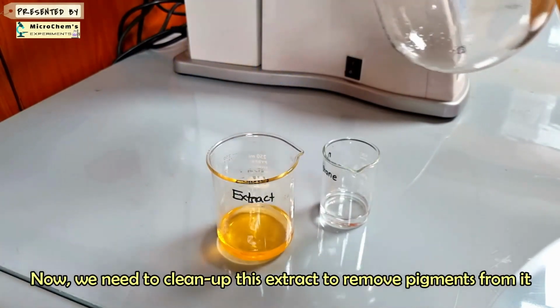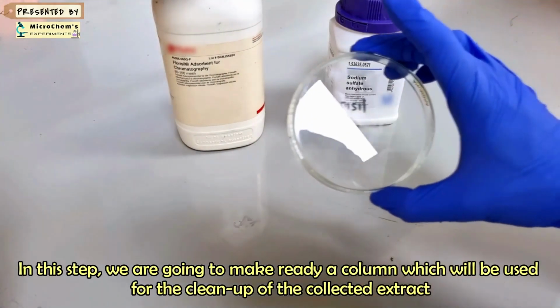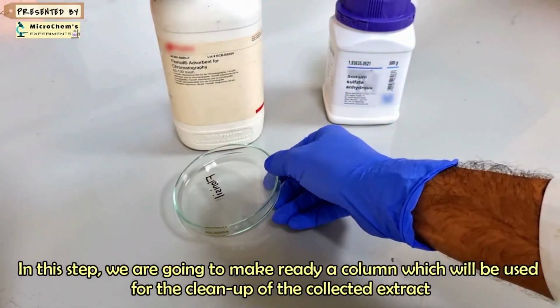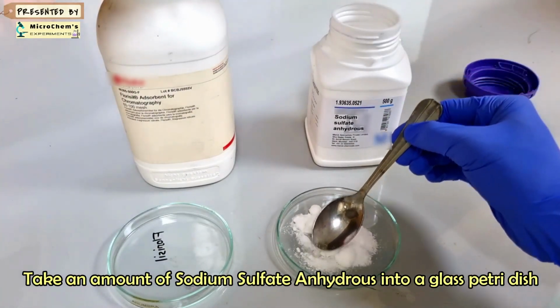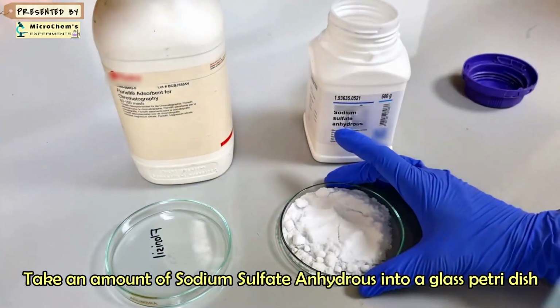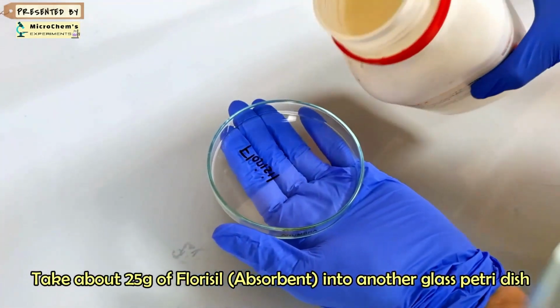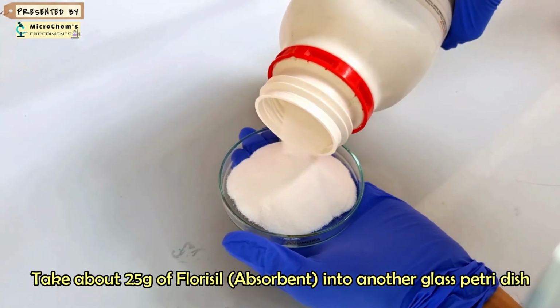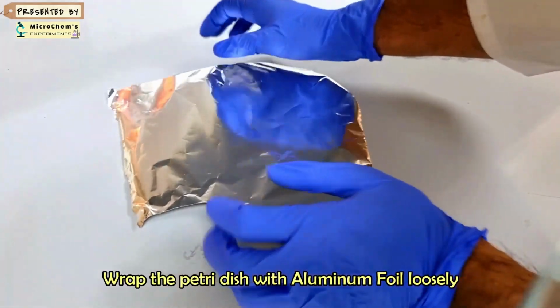In the next step, we will use the USEPA 3620C florisil method for the cleanup of the sample extract. In this step, we will prepare a column for the cleanup of the collected extract. Take an amount of sodium sulfate anhydrous in another glass dish. Take about 25 grams of florisil in a glass dish, loosely covered with aluminum foil. Use activated florisil PR grade.